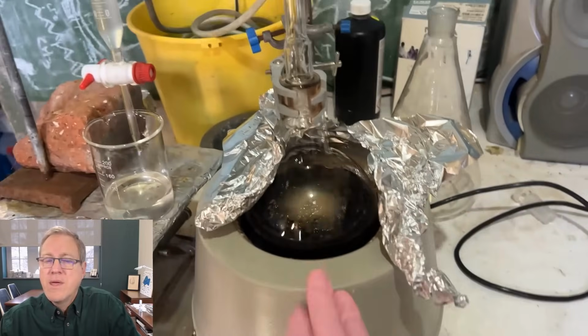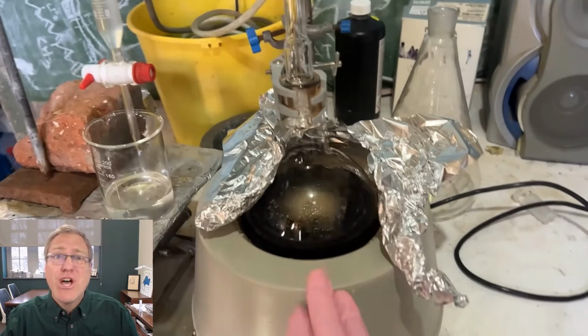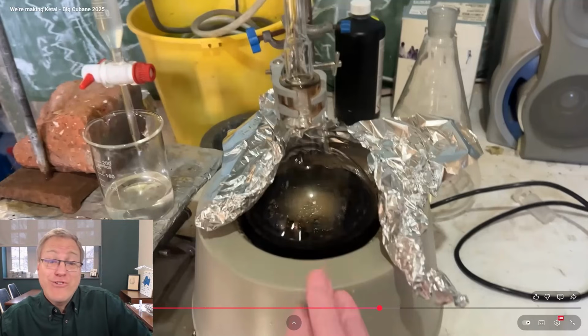Maybe. Definitely. Anytime you heat reactions, you're going to get some discoloration. This is not a surprise. I'm not saying you should be excited about it, and he's clearly not excited about it, but it happens. You just got to run with it.